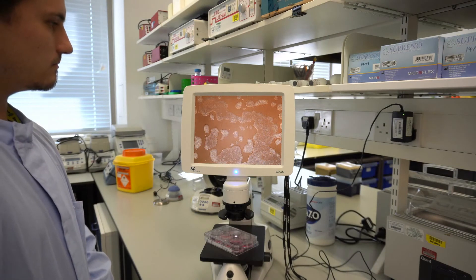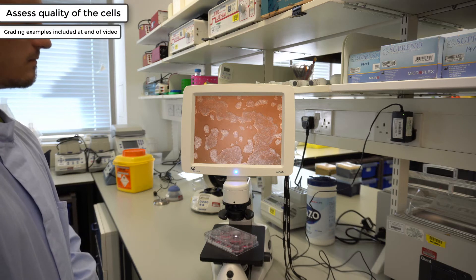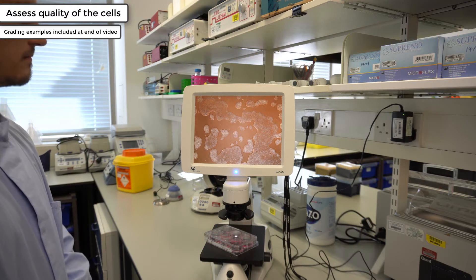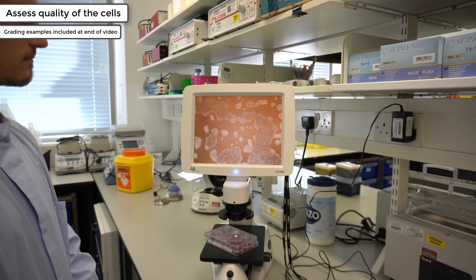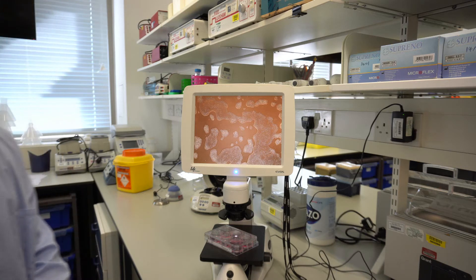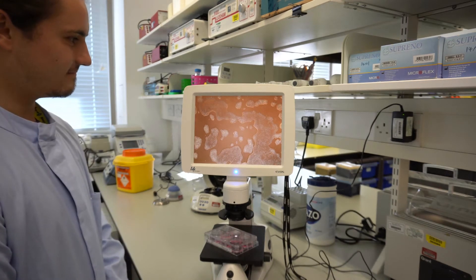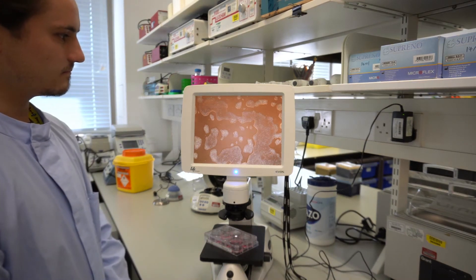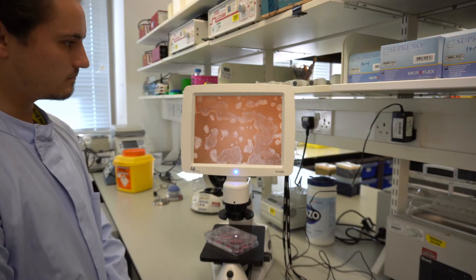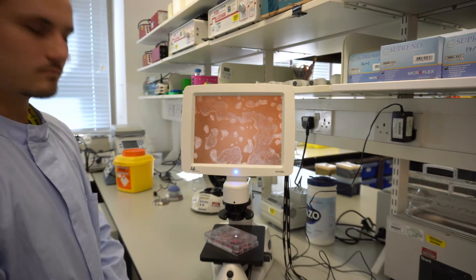It's also very useful to have a grading system for your IPS cells. Here in CGAP, we grade IPSCs from A to D based on several aspects, including how compacted the cells are, how smooth the edges of the colonies are, and whether or not there's any differentiation present. All the cells we have today are A-grade, and you can see how smooth the edges of the colonies are and how compacted the cells are — these are all things you look for when grading.